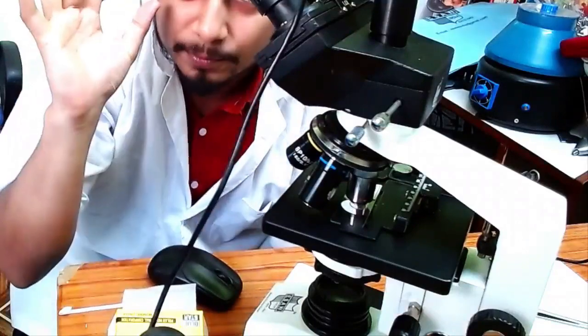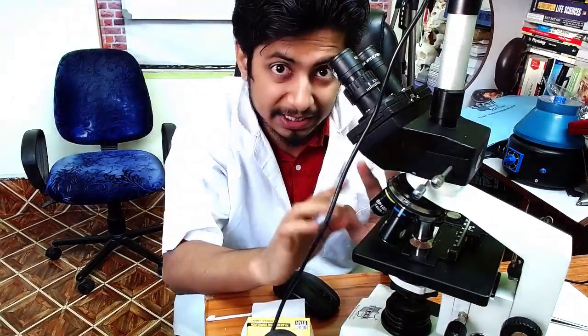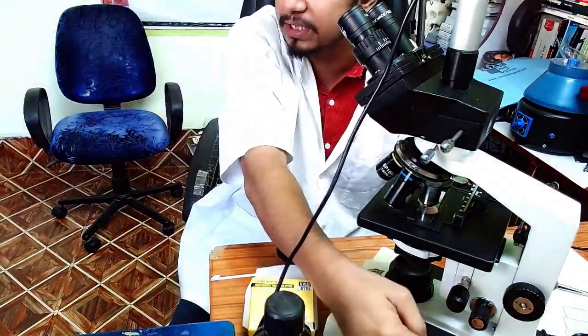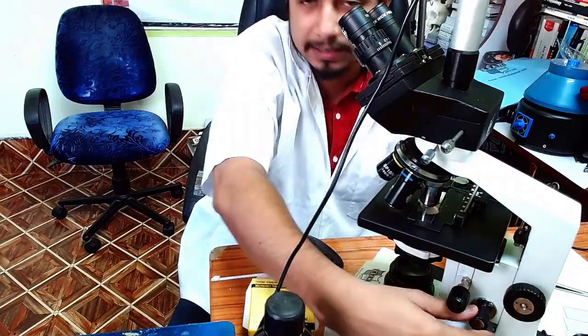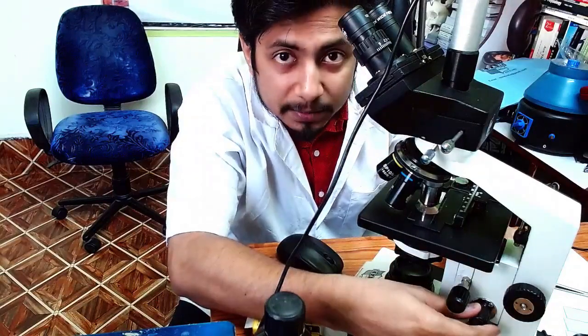Now that the stage cannot go up further without touching the lens, the maximum limit is achieved. What we will do now is use the coarse adjustment screw — you can see the coarse adjustment screw here. The coarse adjustment is done first, and then we move on to the fine adjustment screw.